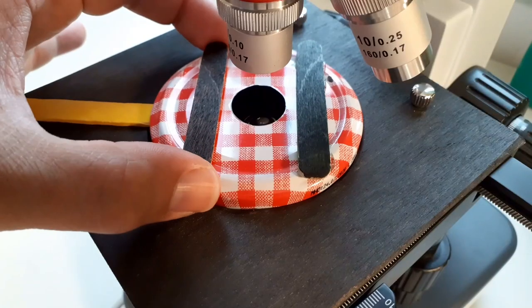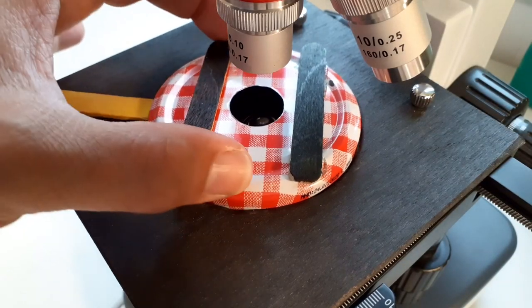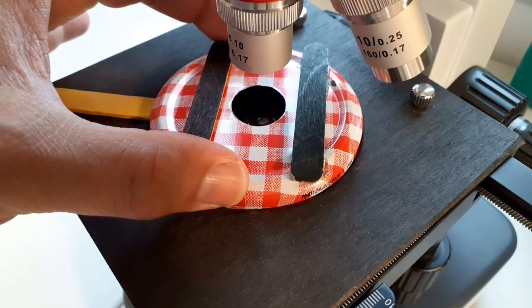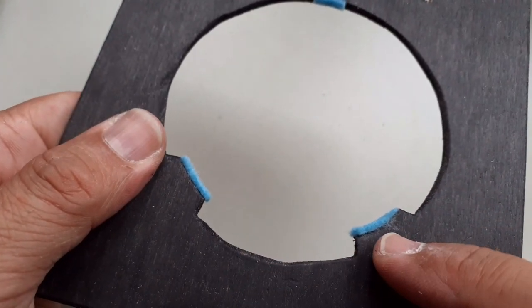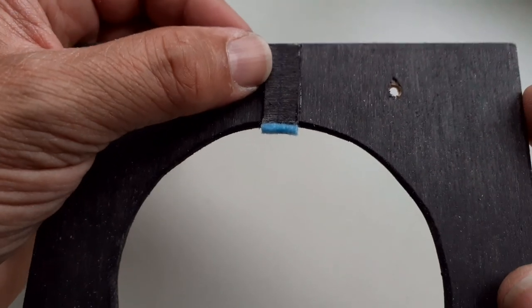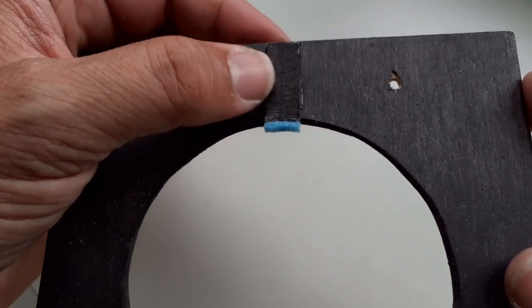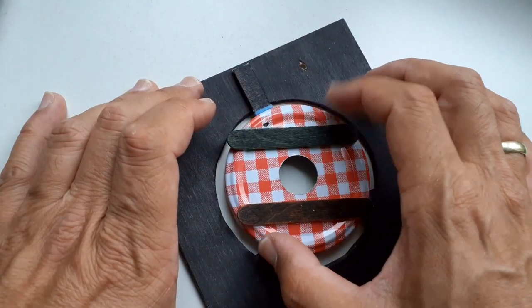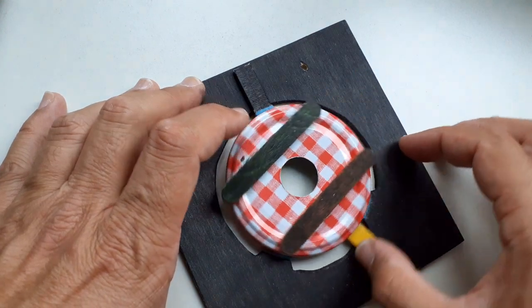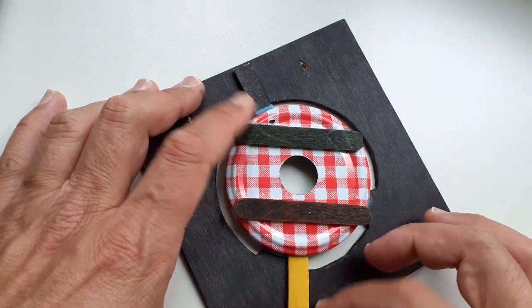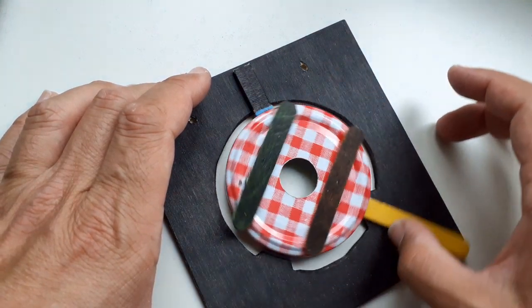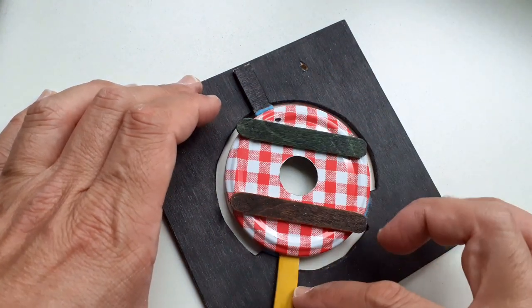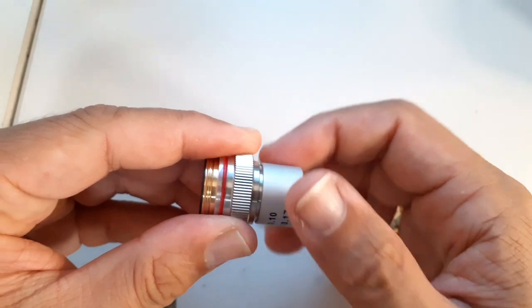Then it was already ready to be tested, but it was a little bit wobbly. I decided to cut out a little bit more and glued some felt to those little extensions. Now everything was more stable and could be operated more smoothly. That's basically the system I chose to use, and I was quite happy with that result.